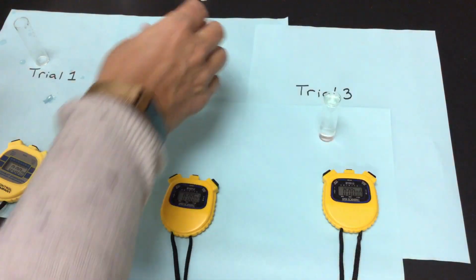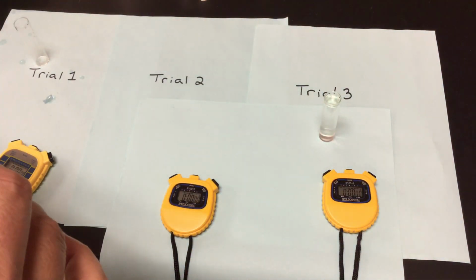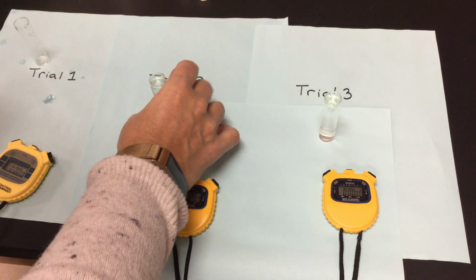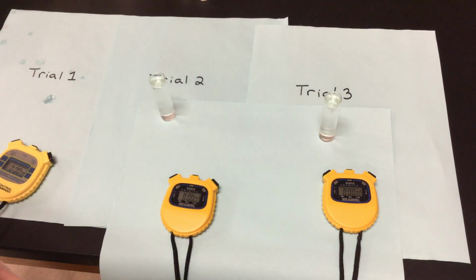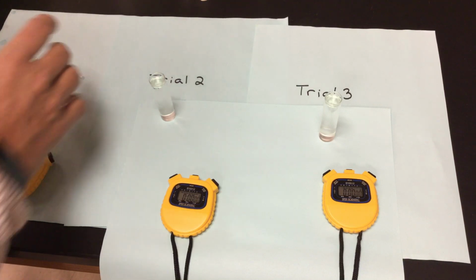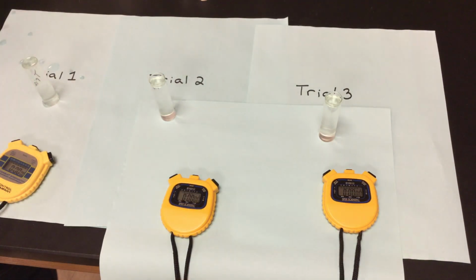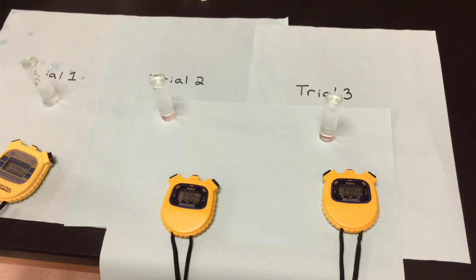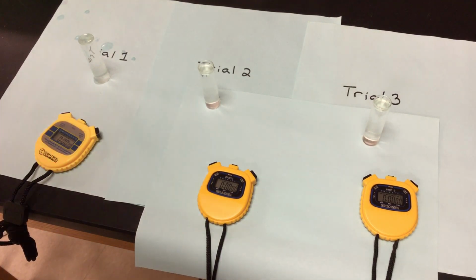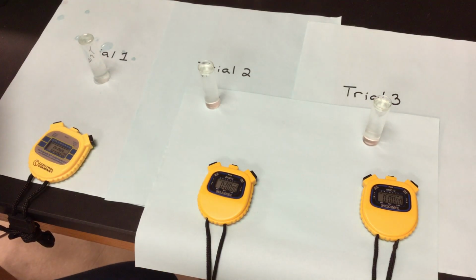There's trial number 3 for a pH of 9. Here's trial 2 for a pH of 9. And my trial 1, and we're still doing everything else the same. I'm still going to do my yeast solution, my living organism that has the enzyme catalase in it. And we want that catalase within my yeast to break down the hydrogen peroxide so that it can produce the little oxygen bubbles and bring it up to the top. We want to see how well that yeast solution is physically working.